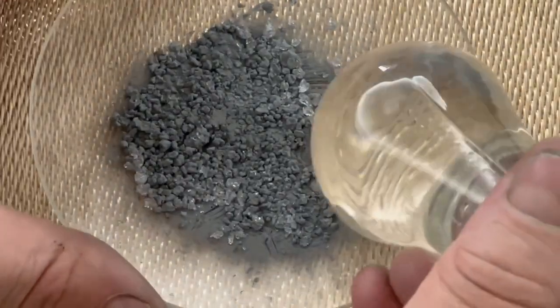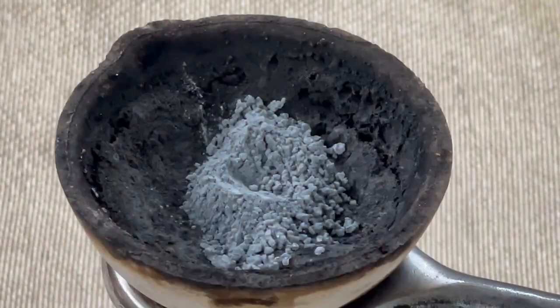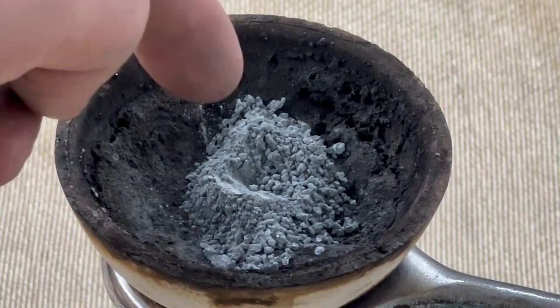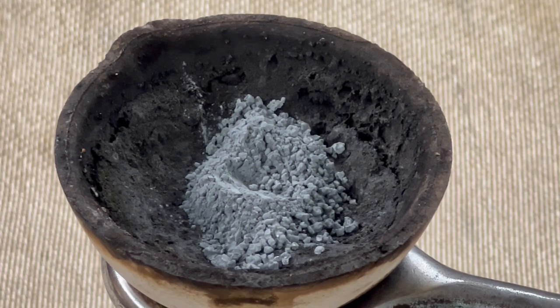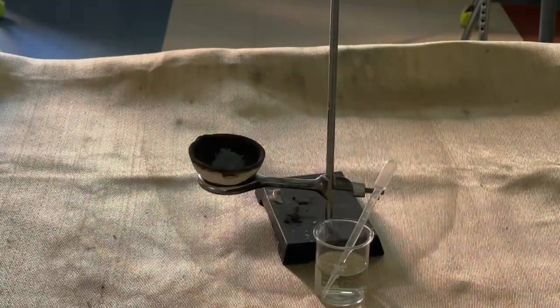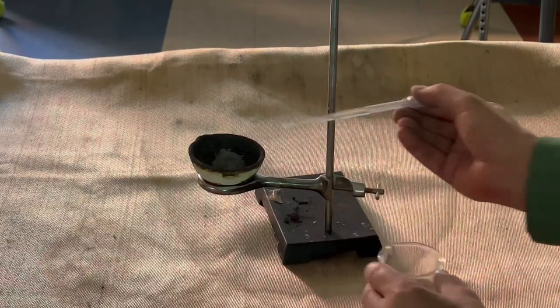For the larger crystals, break them up until you have a nice fine powder. Now you're ready to transfer your mixture to a crucible. Make a little divot right there in the middle for a drop of water. This is an exothermic reaction — it's going to produce a fair amount of heat as that zinc is oxidized. Now we're ready to add just a drop of water. Watch what happens.